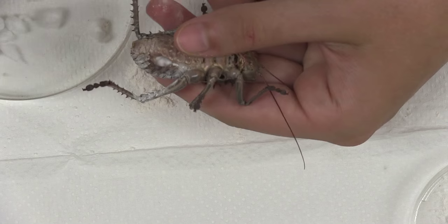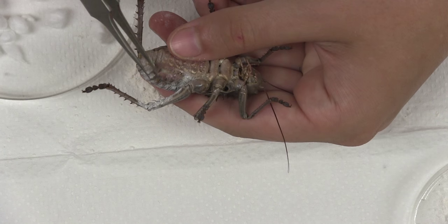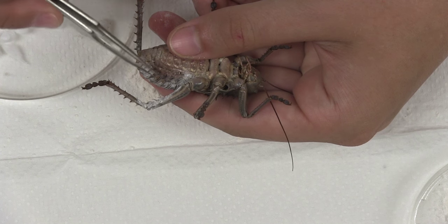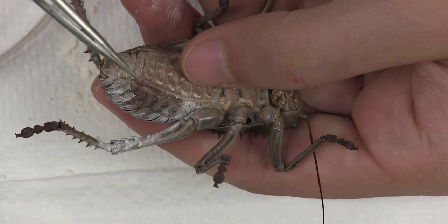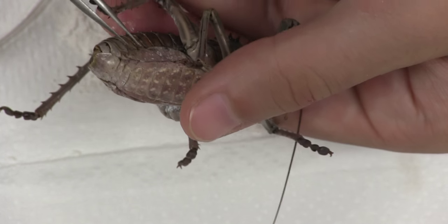When you are done stuffing, carefully use your fine tipped forceps to close the incision so that when the insect dries, it will be invisible. In the end, make sure that the incision is closed neatly and properly so that your specimen looks something like the one here.